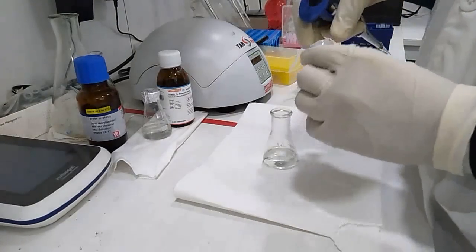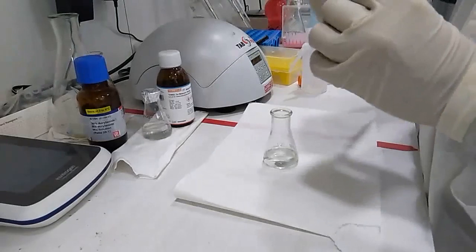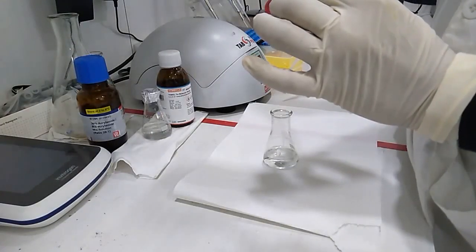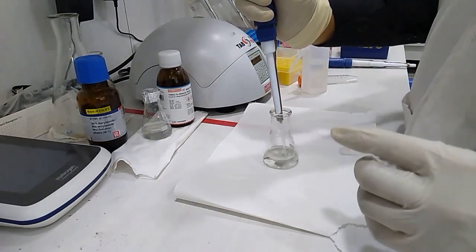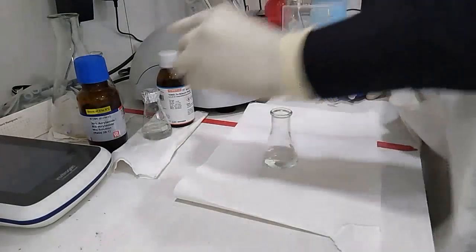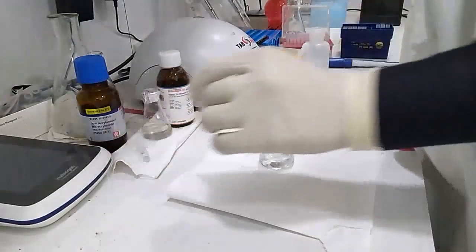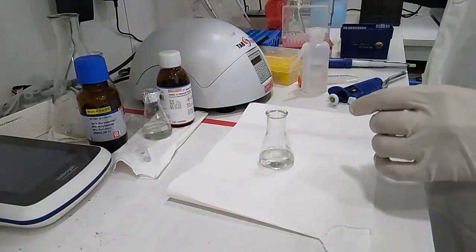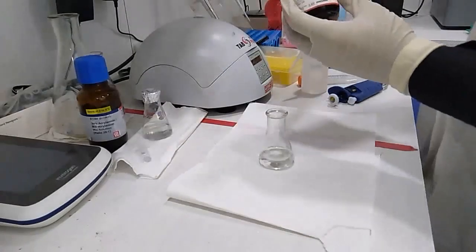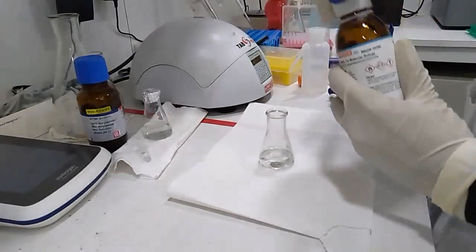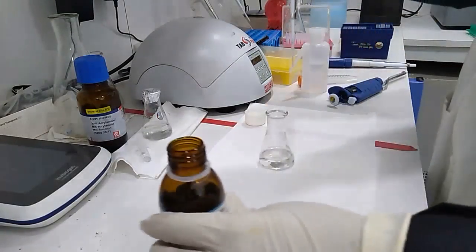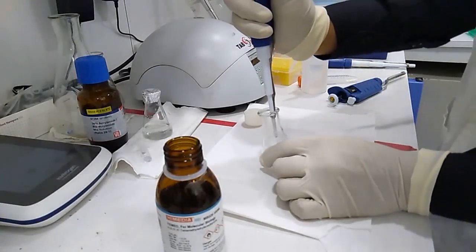Okay, then we will add 5x TAE solution. Now we will add ammonium persulfate solution as well as we will add TEMED. This is crucial stage, we need to hurry.